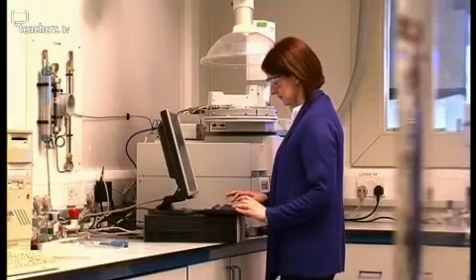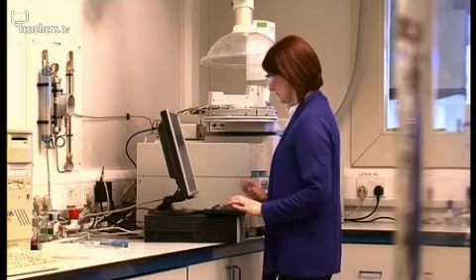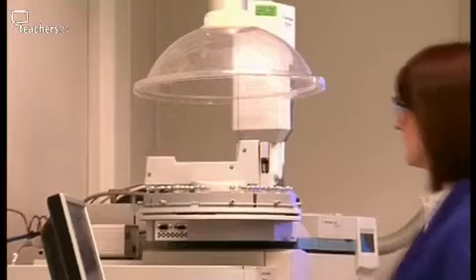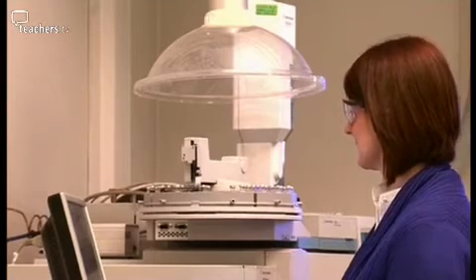Giving it a go meant firing up the GCMS to test the fly pupae casings. Gas chromatography, mass spectrometry, or GCMS, is combining gas chromatography with identification using the mass spectrometer. So the gas chromatography is a separation technique on its own. However, the identification comes from the mass spectrometer. By combining the two together, you have a really useful instrument in forensics, in chemistry, in science in general.